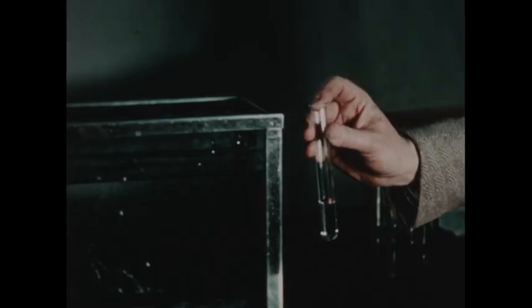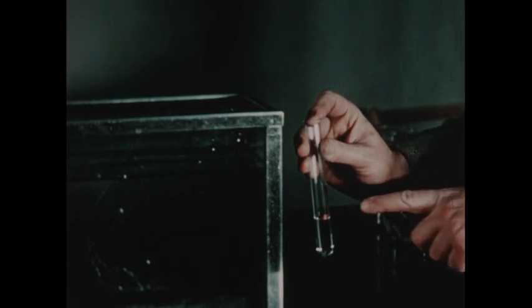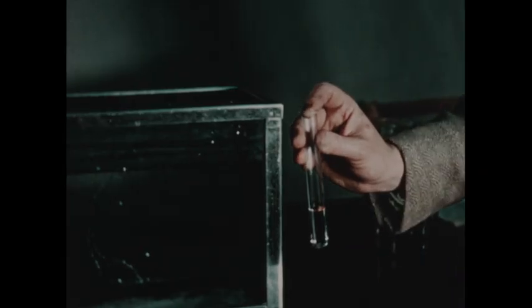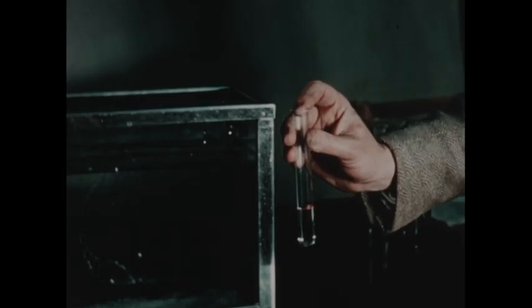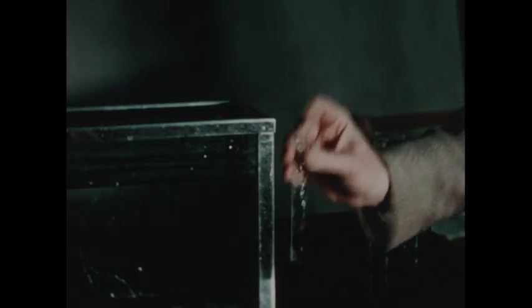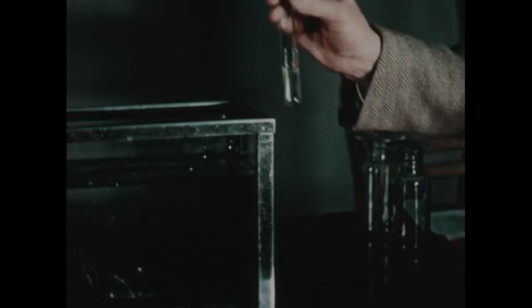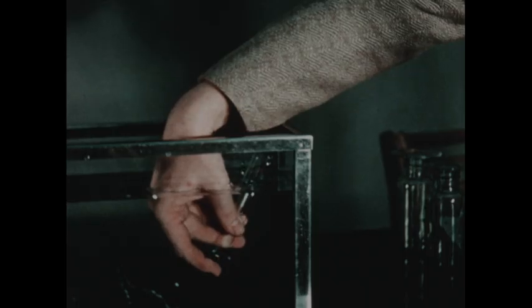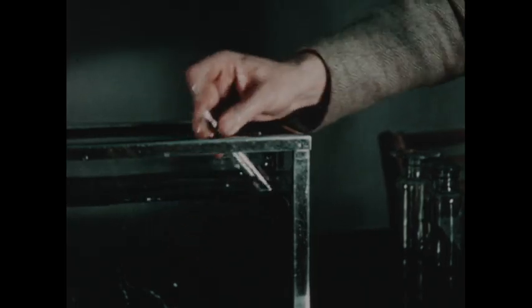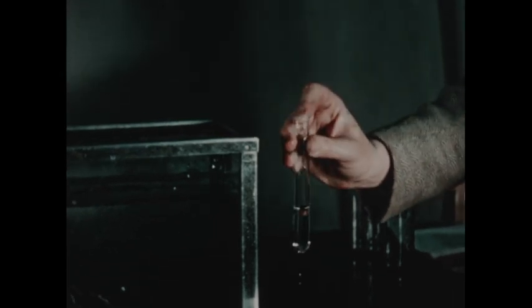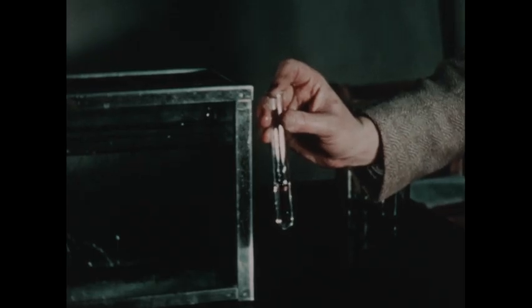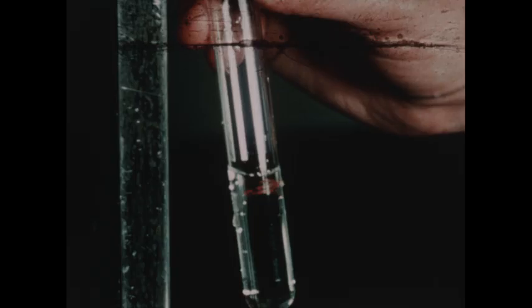In order to demonstrate the relative insolubility of nitric oxide in water, we have here some nitric oxide confined in a test tube containing a small amount of water. Again, the level of the water has been marked with the red pencil. Now, we can vigorously shake this tube, bringing the gas and the water into intimate contact, and then removing the finger from the tube under water, replacing it, returning outside. We see that a little water has entered the tube, but not nearly as much as before when we were using laughing gas. Nitric oxide is then comparatively insoluble in water.